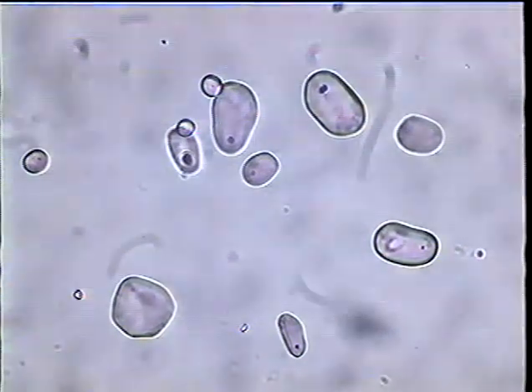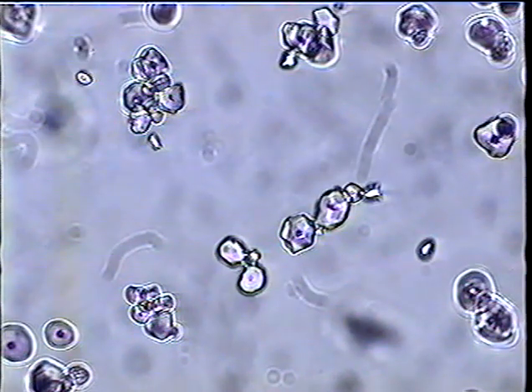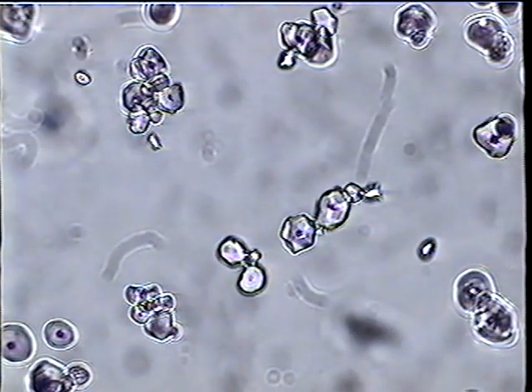These are potato starch grains. Potato starch is a nice, smooth, round, clear, colorless particle, carbohydrate. It's different in shape from starch grains of rice or wheat or cornstarch. These are cornstarch. They're more or less subangular in shape because they grow in a compressed mass of them that press in contact with their neighbors.